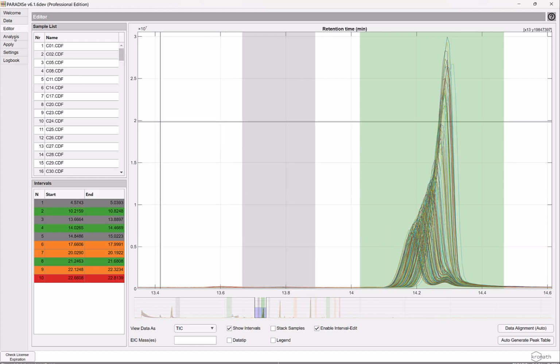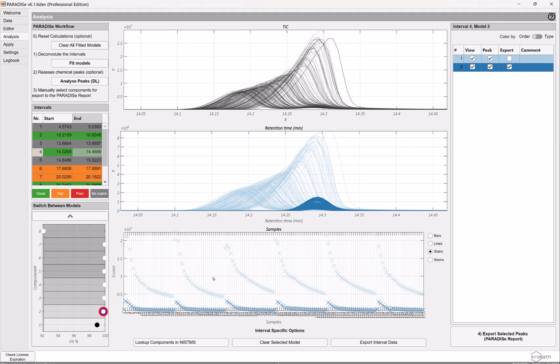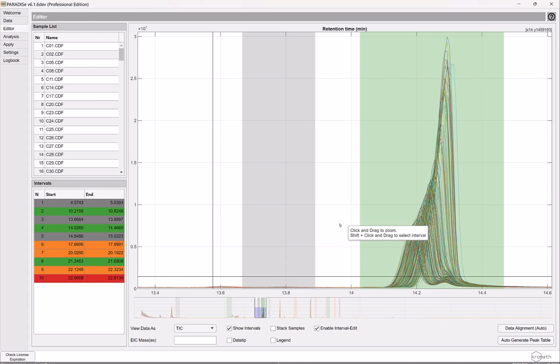But if we go to the analysis window, we can look at how the data has been modeled here. What you can see is the peak, the interval that we selected, and here we see the resolved peaks that are found. And you see how nicely they are separated. We also get the mass spectra down here and the concentrations in each and every sample. But anyway, you see that even though this dark blue peak is completely within the other peak, we can very easily separate that here. Let me go back and find another.